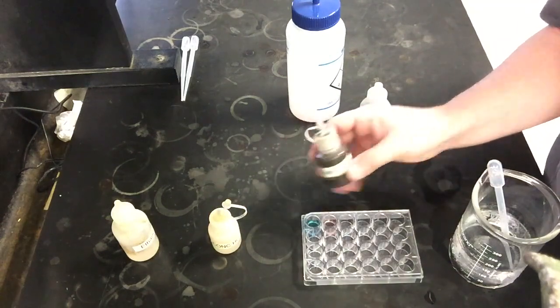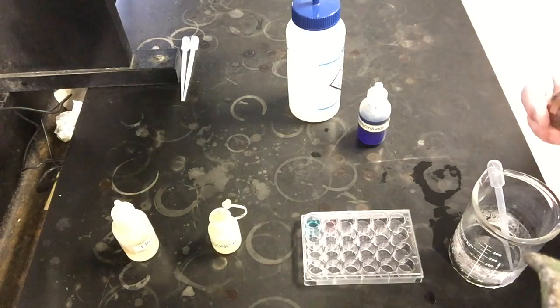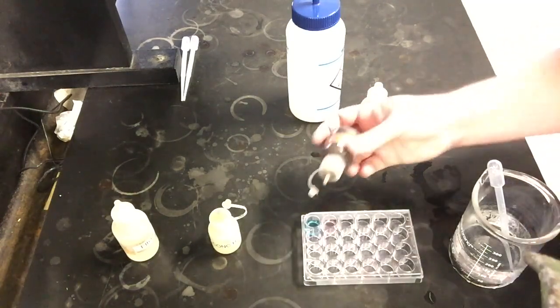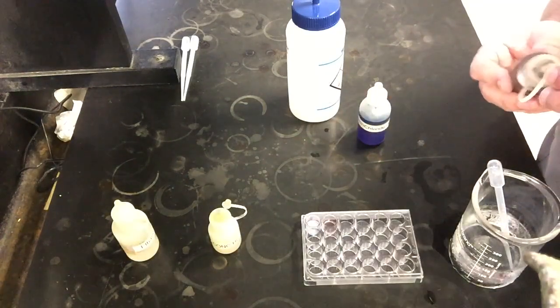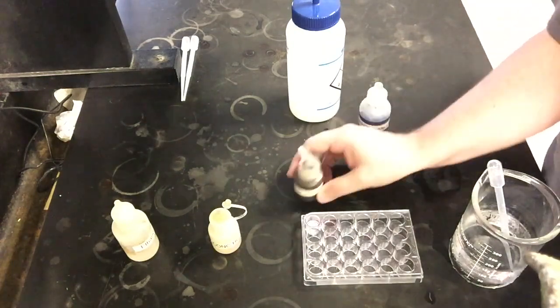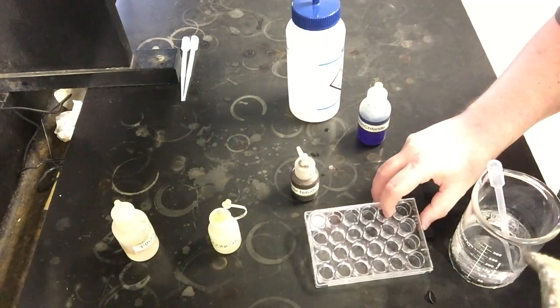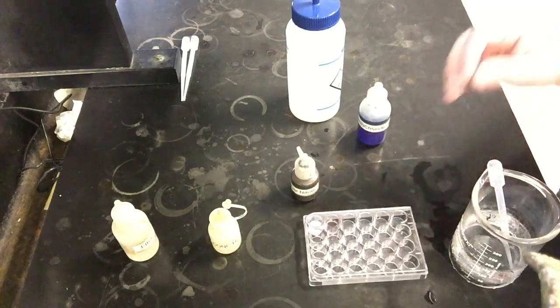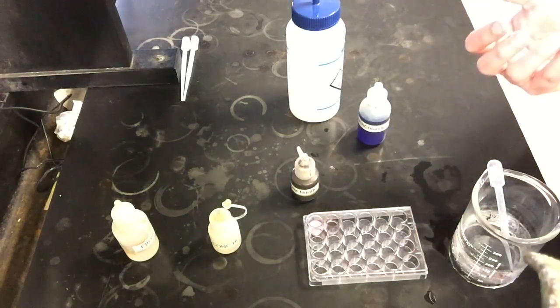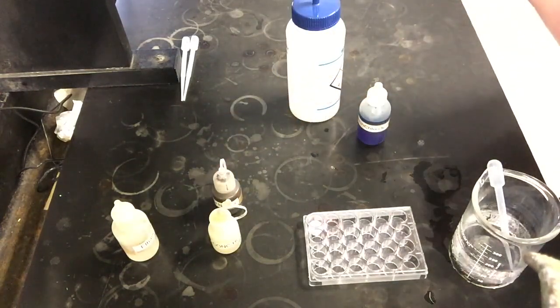And then the other part that we want to take a look at is what happens if I add the silver nitrate. Well, the HCl just turned things blue. Now if I add the silver nitrate to that same well, I actually see a couple things happen. Right? So there are two things visually occurring here when I add the silver nitrate. One, I'm getting kind of that white chunky solid. You see a whiteness to that solution that you didn't see before. And if you can see the solution, it is back to having a pink tinge to it.